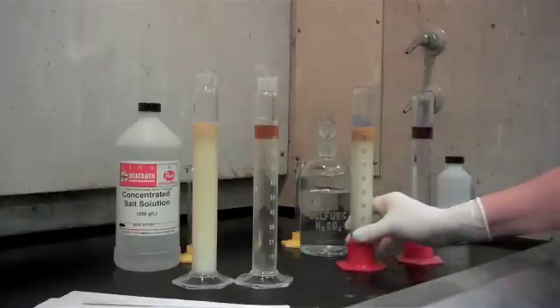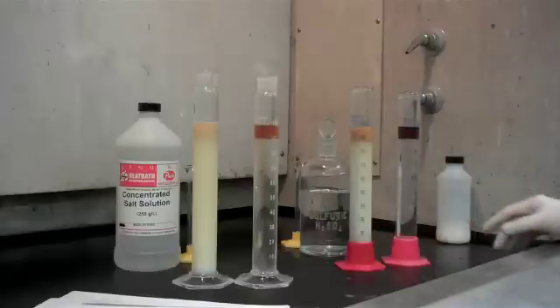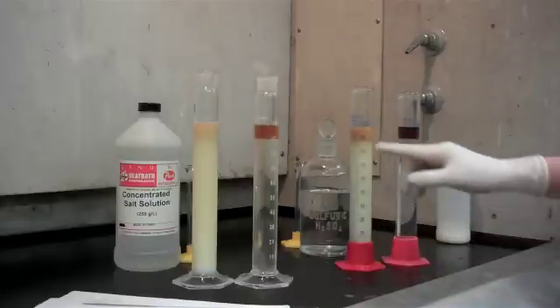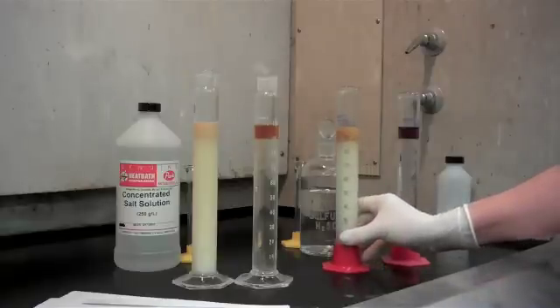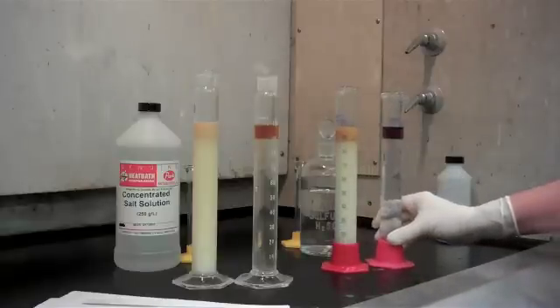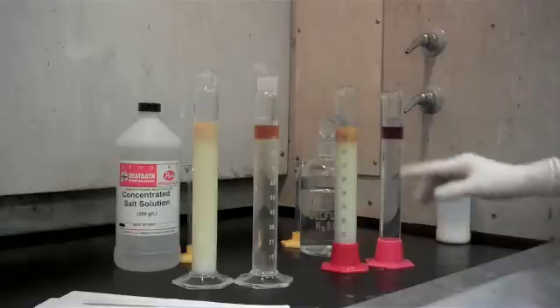This sample we had done with the sulfuric acid. As you can see, the sulfuric acid splits the sample quicker. But again, it's not quite done yet. When all the oil has split out, it should look like this.